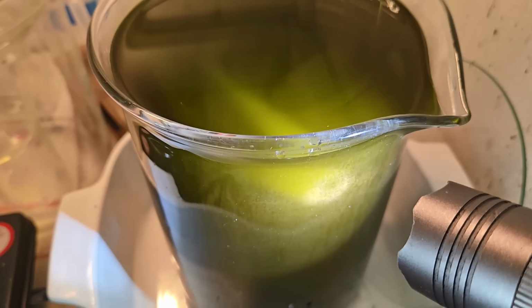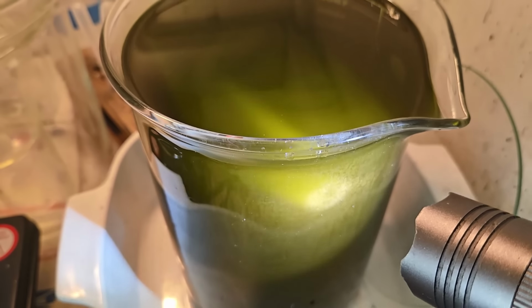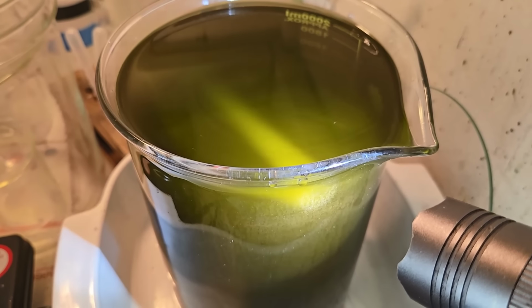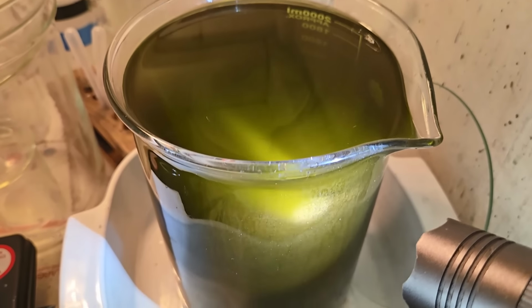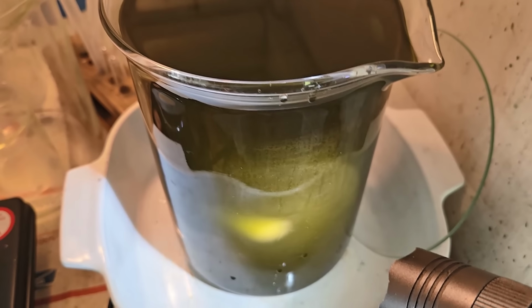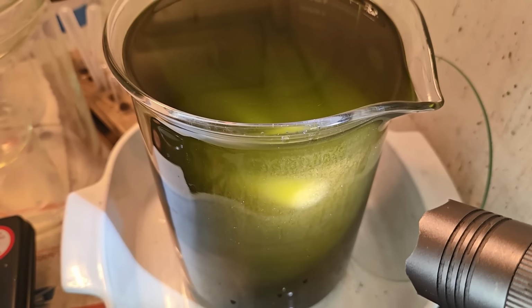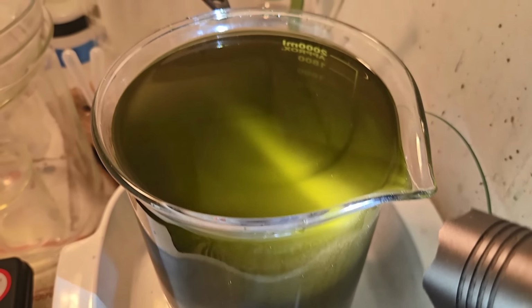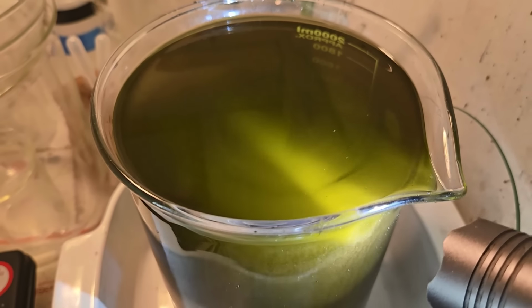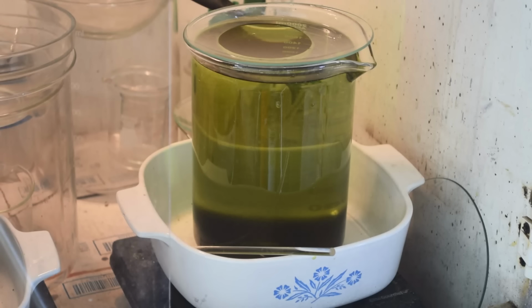Once the liquid clarifies, do a stannous chloride test on it to make sure we've got all of the gold out of solution. If not, I'll transfer it to a larger beaker and put some more iron sulfate on it. But I think we're getting a pretty good gold drop. I think it's all going to come out of solution eventually. It's going to take a little while.